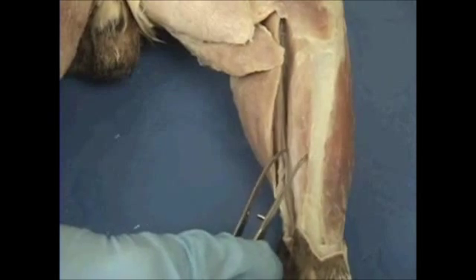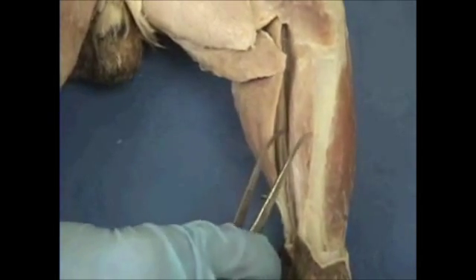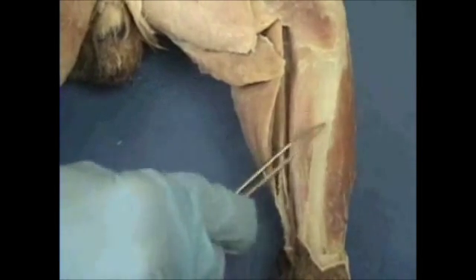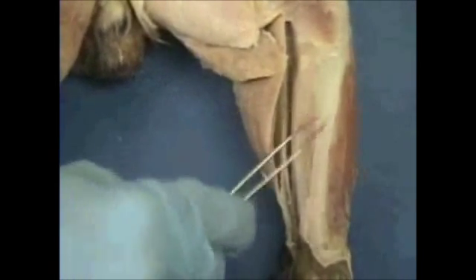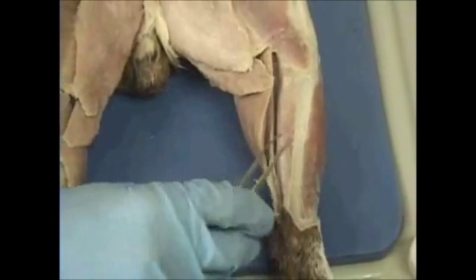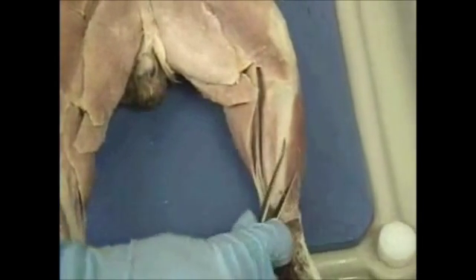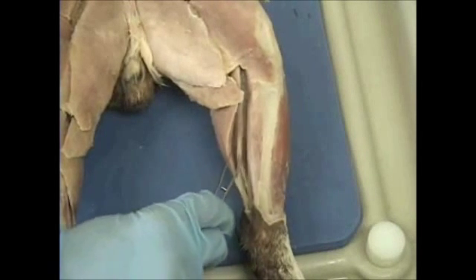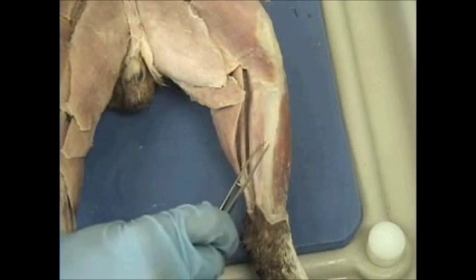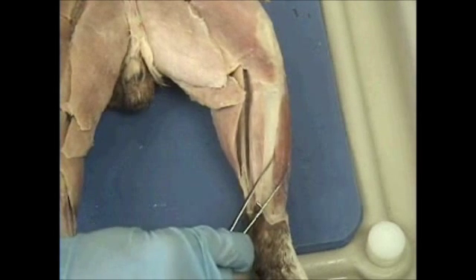In the medial view of the leg we have our flexor digitorum longus. So gastrocnemius, soleus, and flexor digitorum longus. What bone is this? The tibia bone. Remember, always behind the tibia bone you have your flexor digitorum longus. Always in front of your tibia bone you have your tibialis anterior.